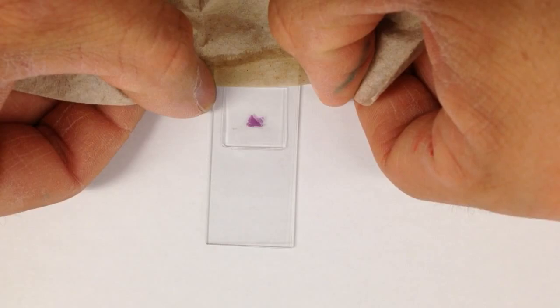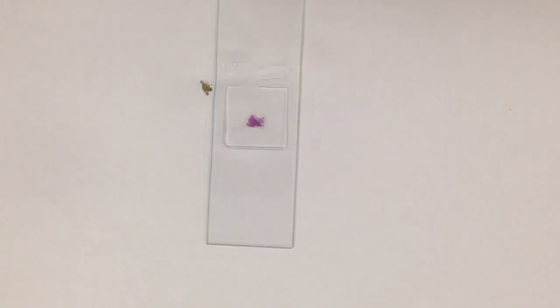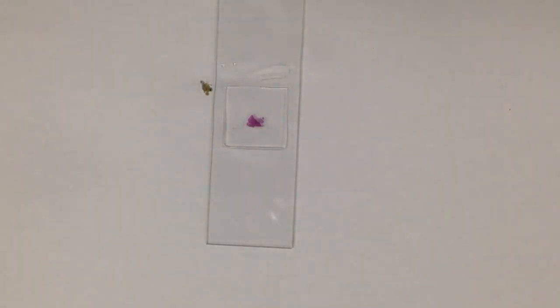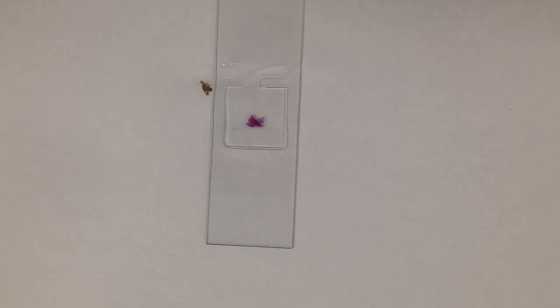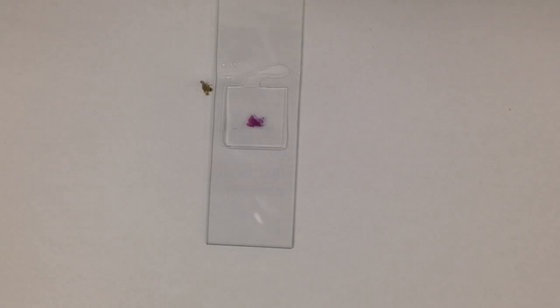When you're done, then you can pull the paper towel off, give it a couple minutes for osmosis to happen, and then you can put this on your microscope slide or microscope stage and view it under magnification. That's how you make a wet mount slide for our lab.